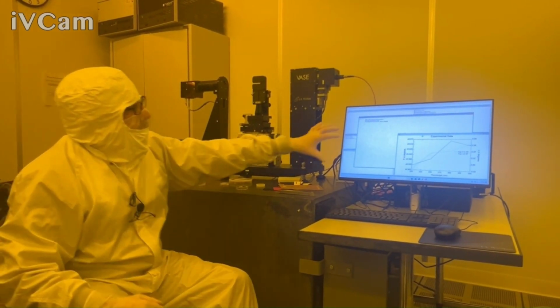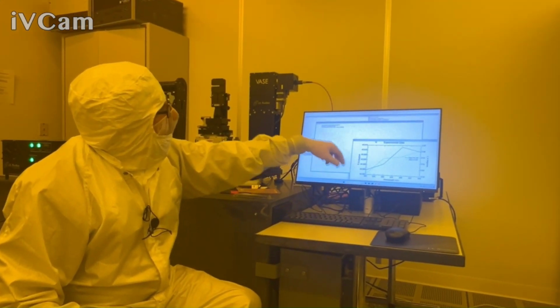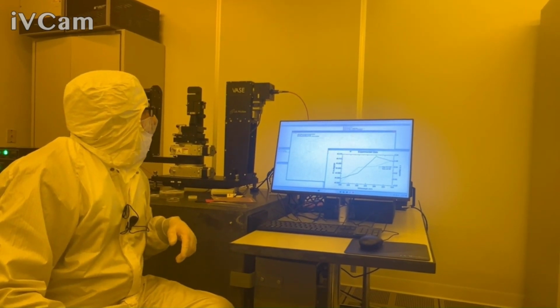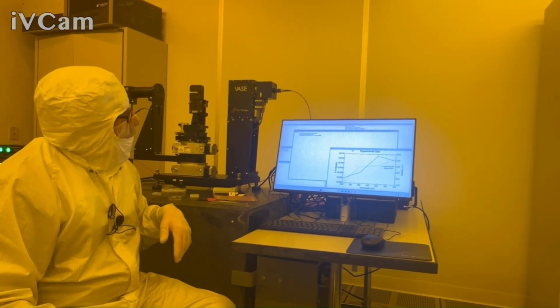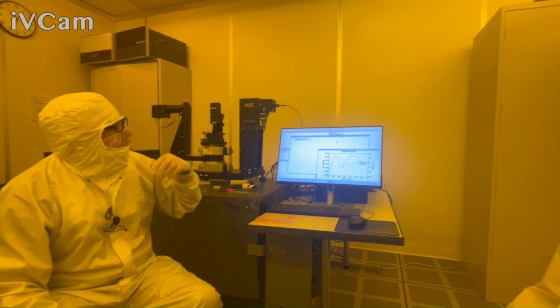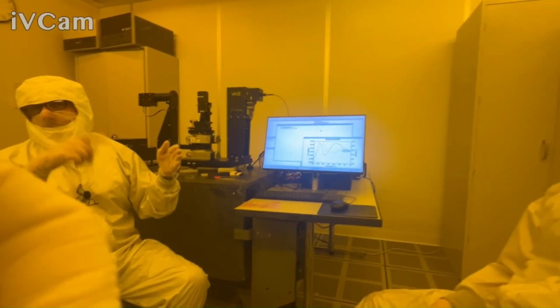So again, there's going to be some deviation here, but this is still very, very small. We'll check this in a little bit. So we'll let that go. Again, delta should stay near 0. Psi should be near 45. Psi is always going to be a little bit easier than delta just because of the rotating analyzer.